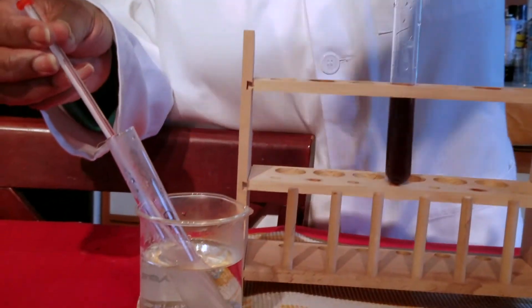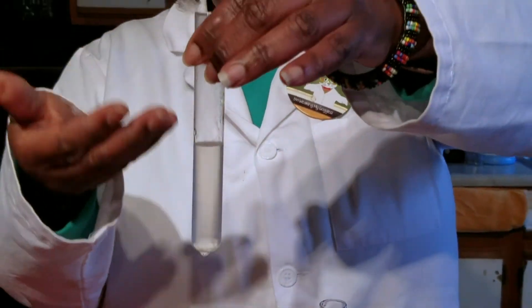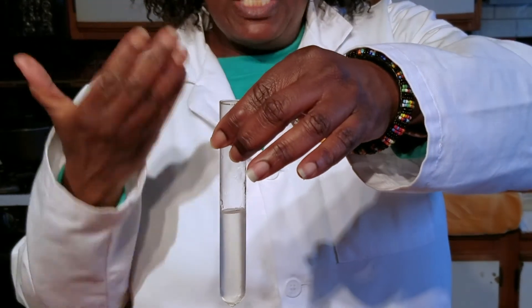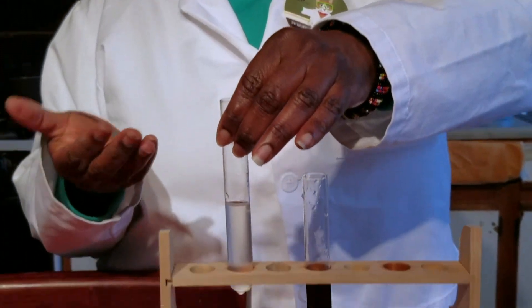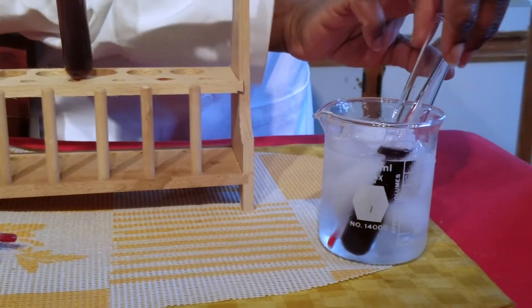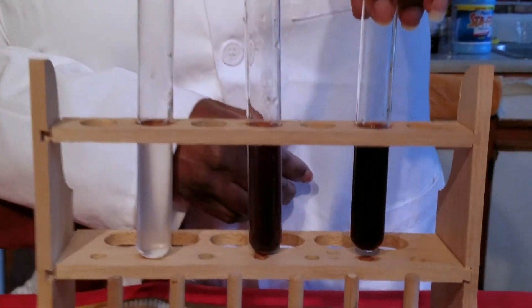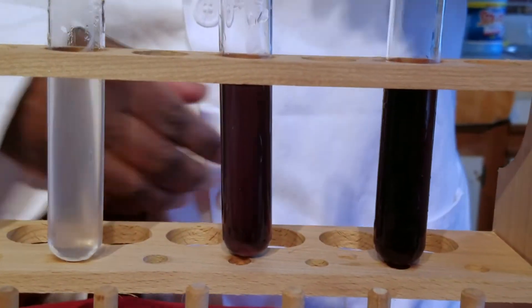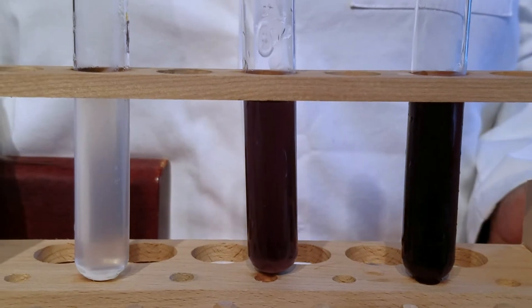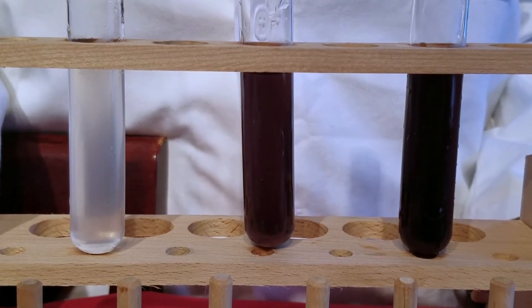We can see that the color has completely disappeared and it has gone back to the cloudy solution. And in the zero degree water, you can see that the color has now intensified. Record these observations in your data table and we'll follow it up with an analysis.